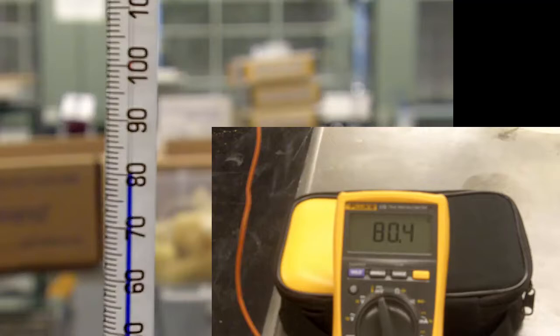When you are doing your melting point experiments you can go fast through the parts that are not of interest or near the melting point. But when you are going through the actual melting point, you do need to slow down your rate significantly - one to two degrees per minute on average is recommended. This will allow the thermometer to accurately measure the temperature instead of lagging behind and reading a temperature that is too low.